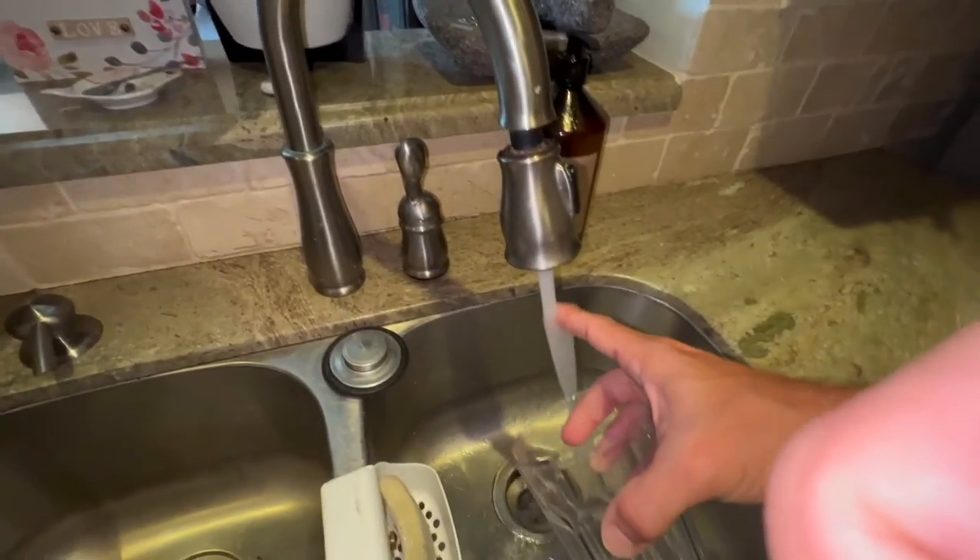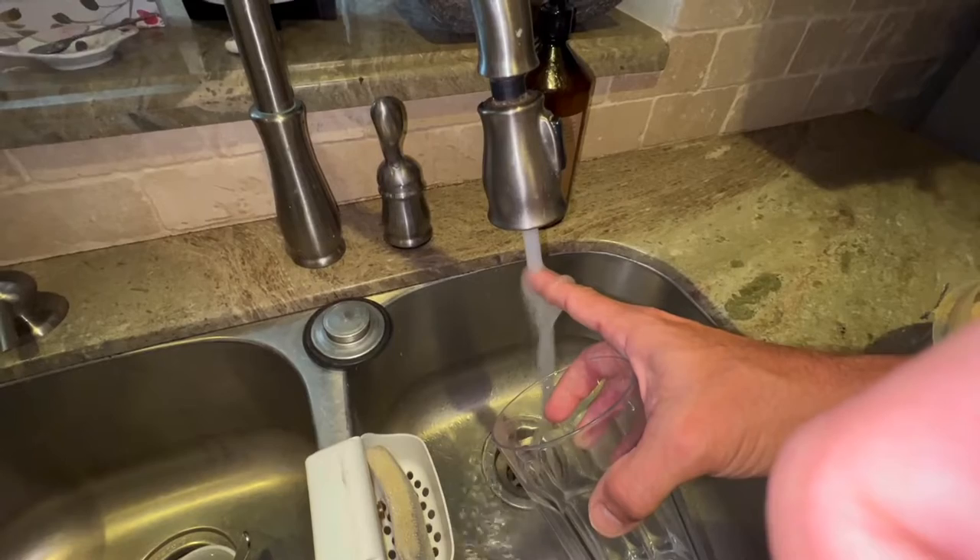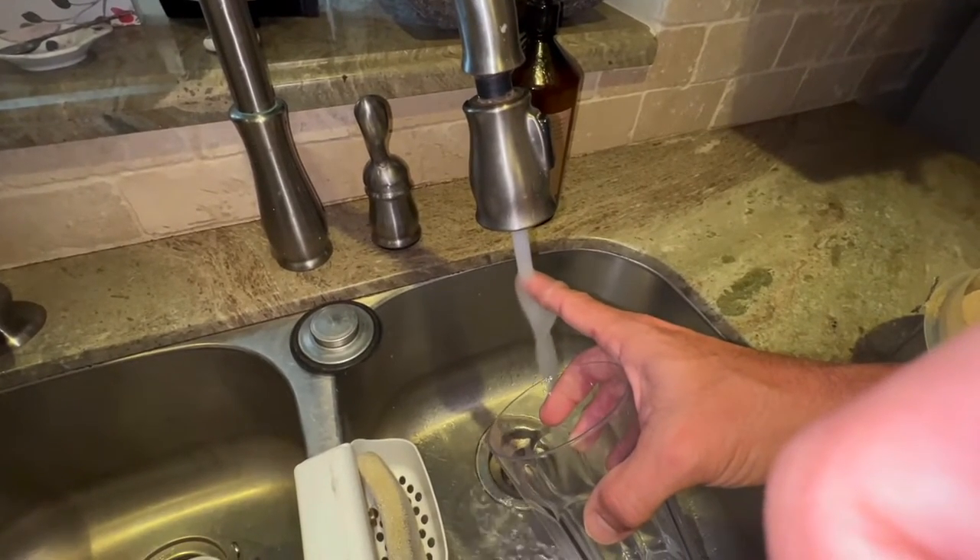I am going to put her in my relaxing chamber — I call it my relaxing chamber. Let's get my rehydration chamber out. This thing's heavy because it's full of water. There's no water in there, I got to put some water in there. Relaxing your butterflies — I use the word relaxing because it's fun. The best way to do it: get some hot water, because hot water molecules evaporate a lot faster than cold water molecules because there's a lot more energy.